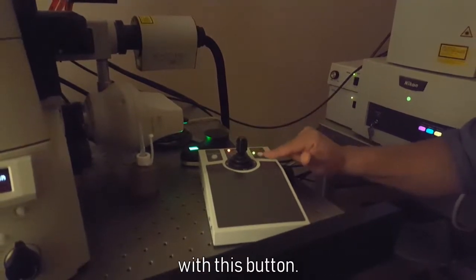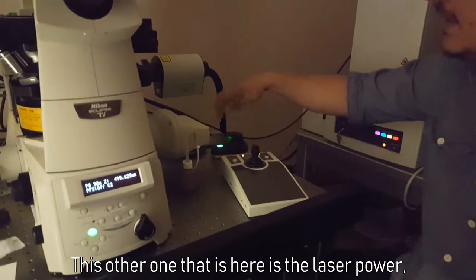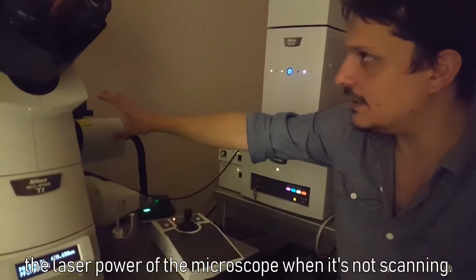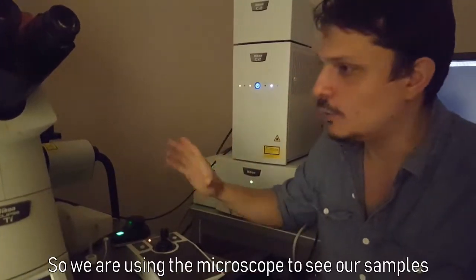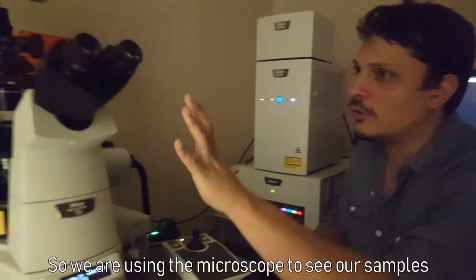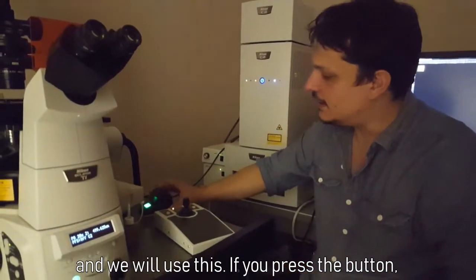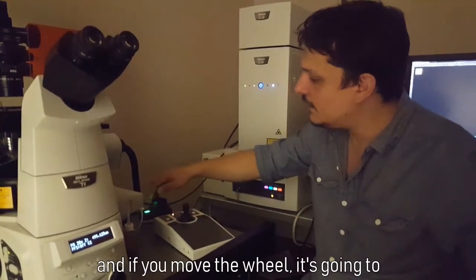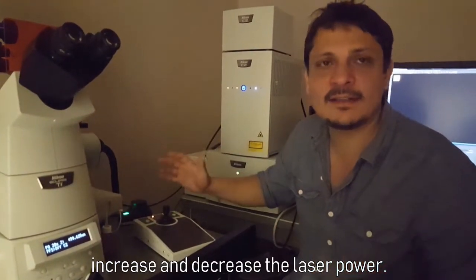This is also one that is using the laser power. It's the laser power of the microscope when it's not scanning. So when we are using the microscope to see our samples, we will use this. If you press the button, it's going to turn on, and if you move the wheel, it is going to increase and decrease the laser power.